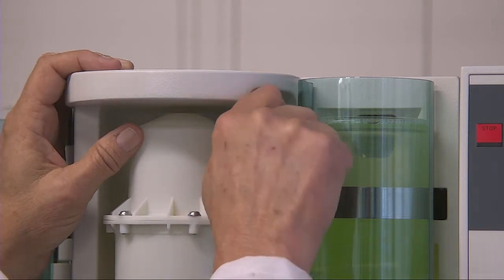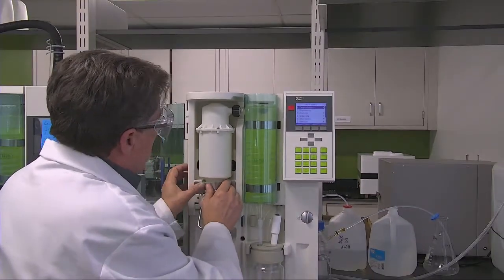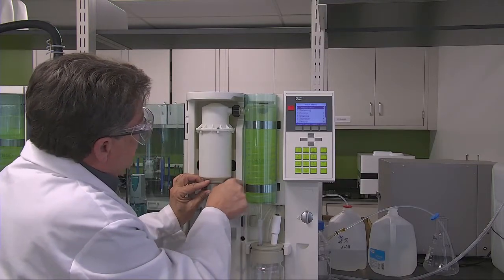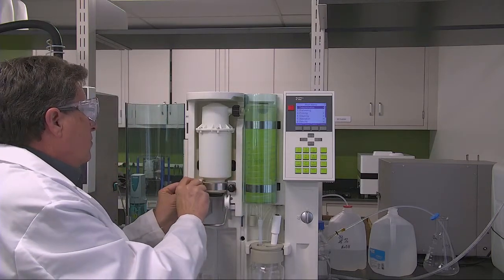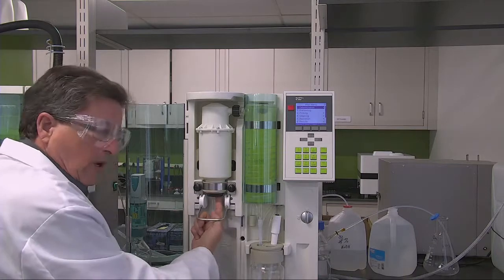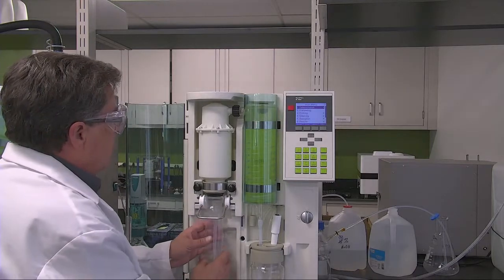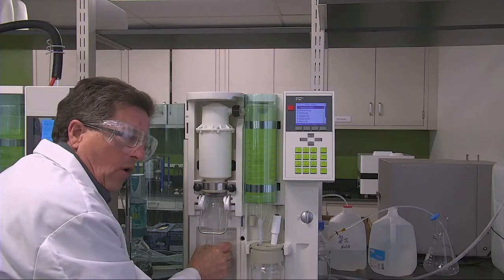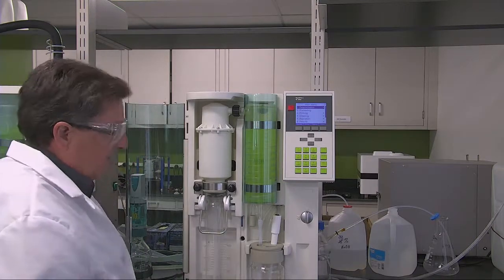So after that is tight, then you can tighten up the bung. And when you put a new bung on the system, you should also change the hypalon, which is located up there. Then when you put your tube on, if everything has been done correctly, you should be able to twist this only if you apply big pressure to twist it. It should be tight now. That way you're not losing nitrogen.